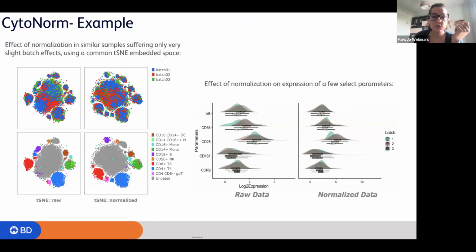If you are in this situation where you see your cells are all spread or your events are all spread in different islands, that couldn't be given to the fact that your t-SNE is not working or you're mad at FlowJo because it's not working really well, but could be given from the fact that you have a batch effect.